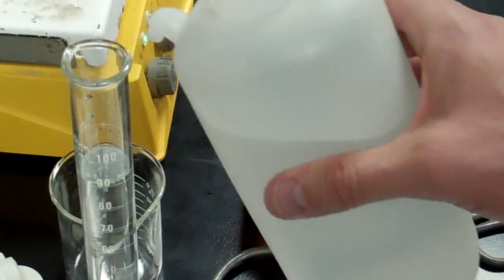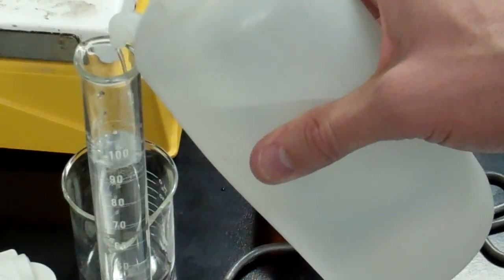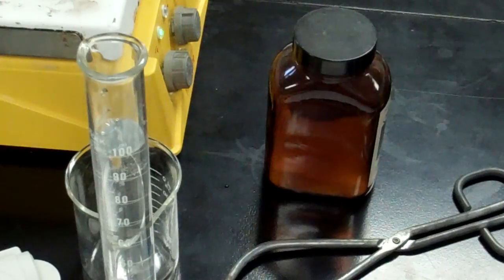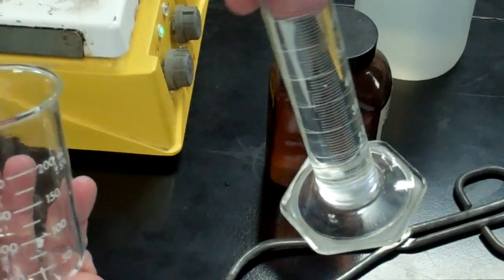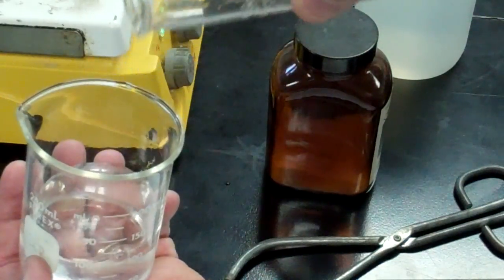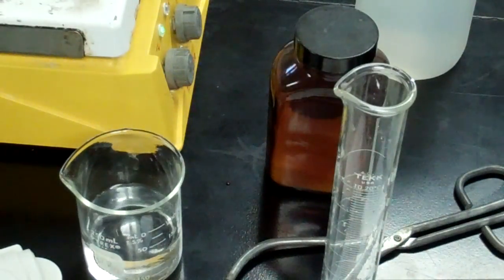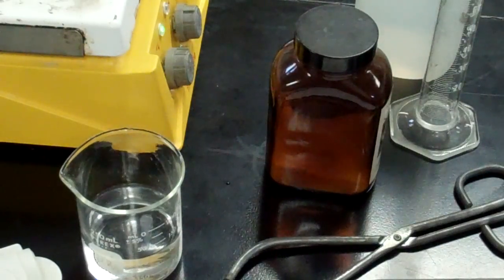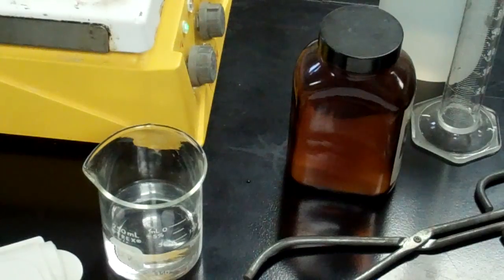Let's see if we can get that in view here. You want to get this level. That is about 100.0. So you'll add this to your beaker. Remember the density of water is 1.00 grams per milliliter. So if you put 100 milliliters of water in that beaker you have 100.00 grams of water in that beaker. Pretty sweet isn't it? So we know the mass of water in there.